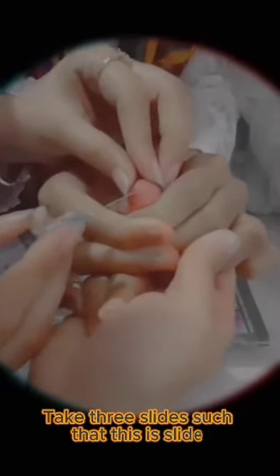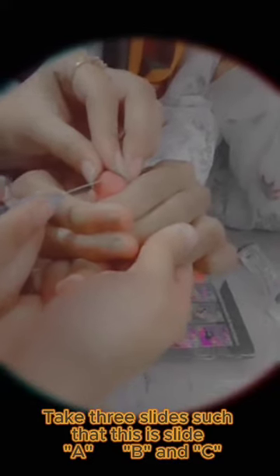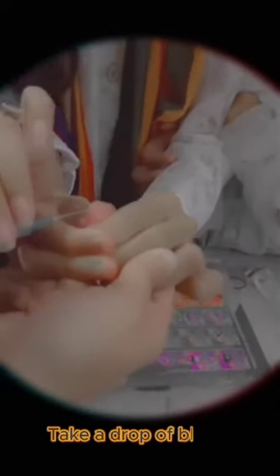Effect of different concentration of salt or sugar on animal cells. Take 3 slides such that this is slide A, B, and C. Take a drop of blood.